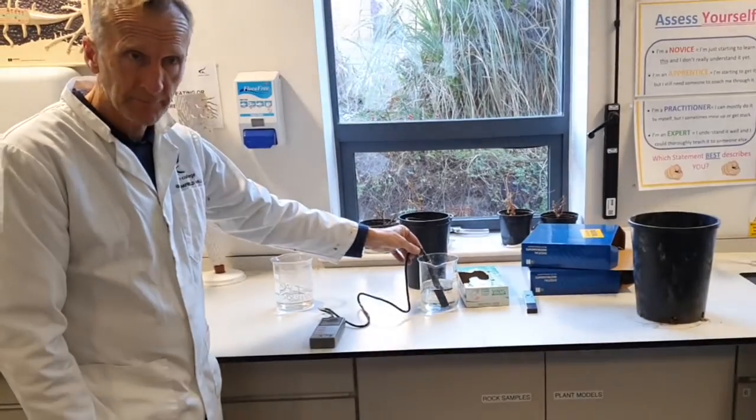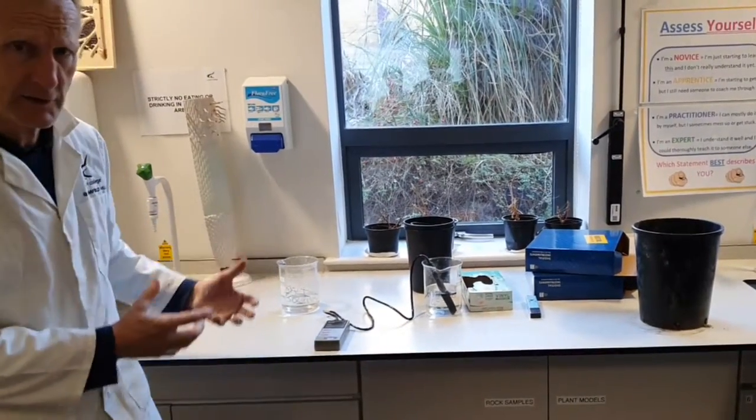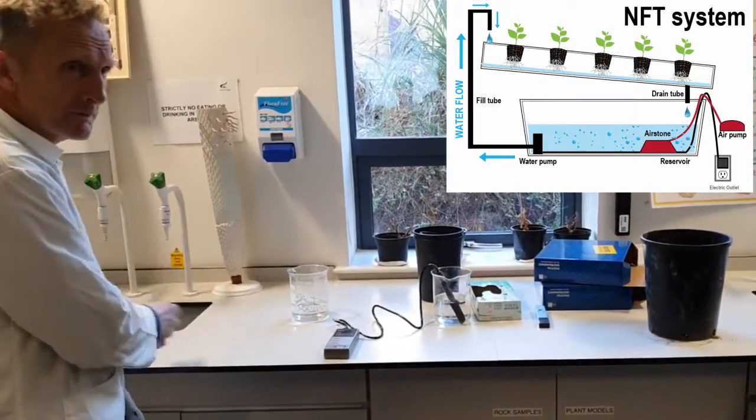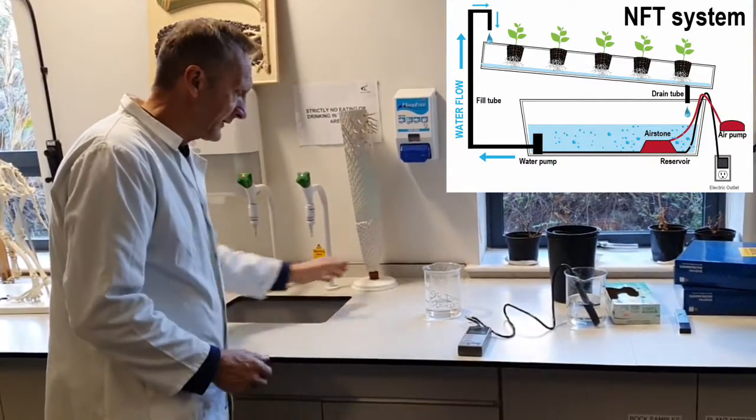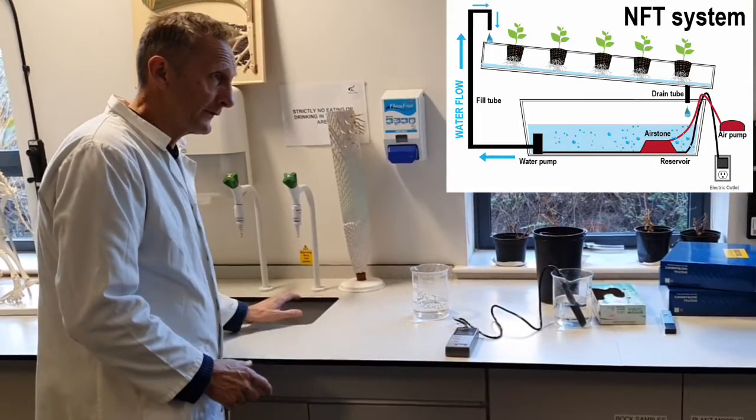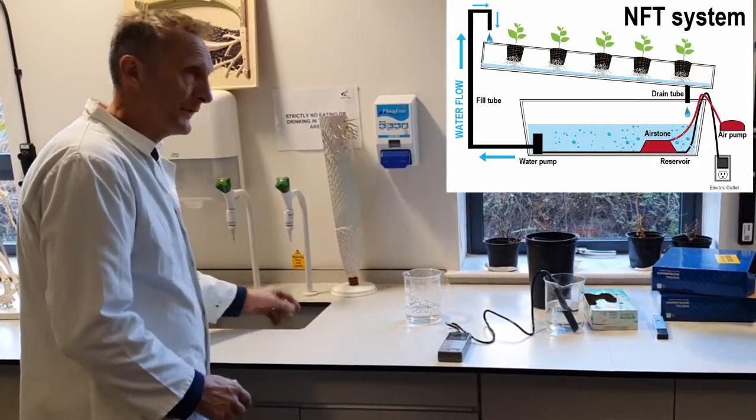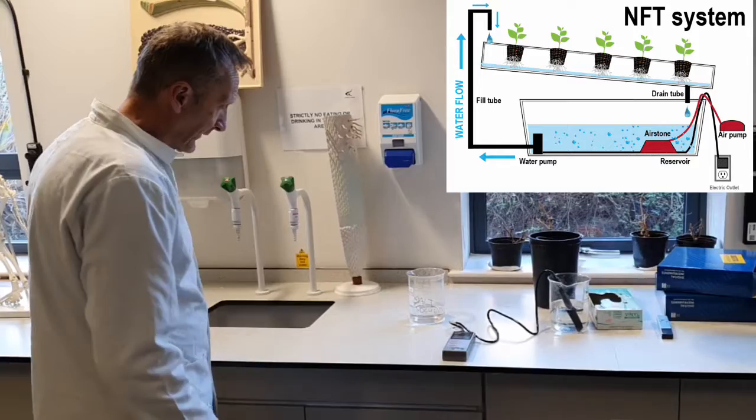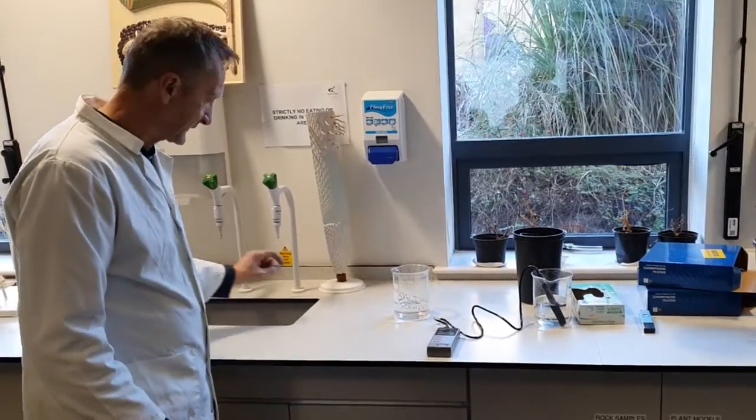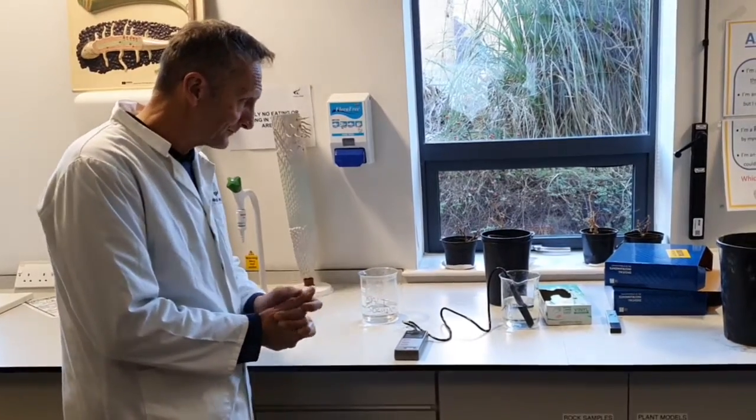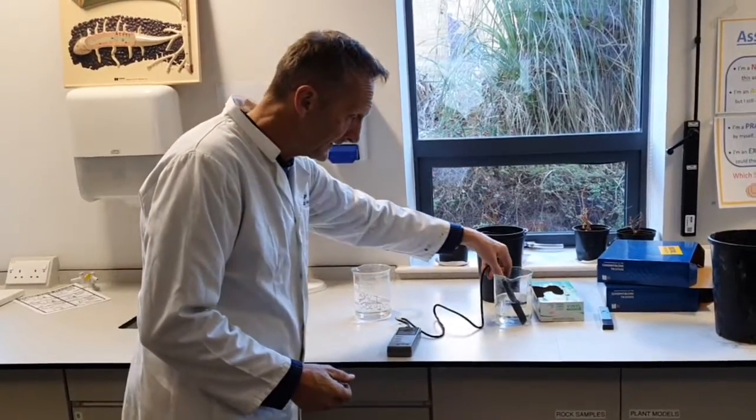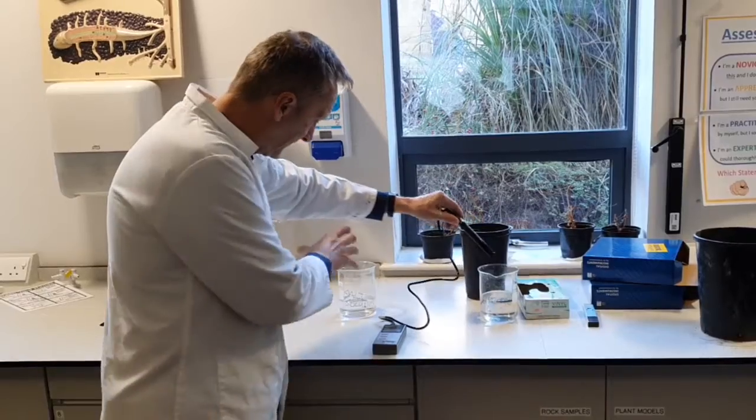The probe is in distilled water. With a hydroponic system, you might be growing tomatoes, cucumbers, or something similar. You'd have a big sink or reservoir where the water runs into with a pump that pumps it up, runs down, and back into the sink. Your sink is going to have your water with your nutrients in it.